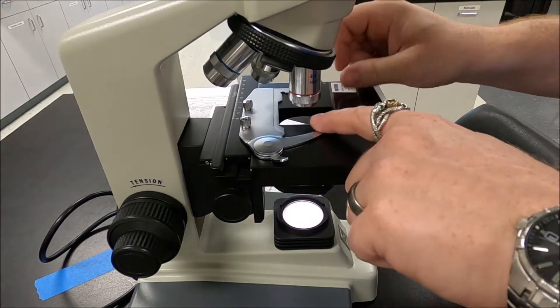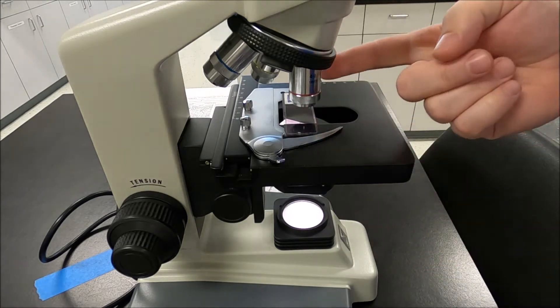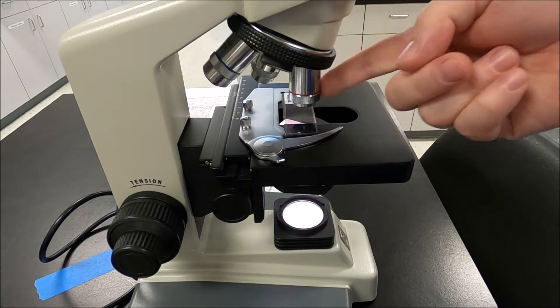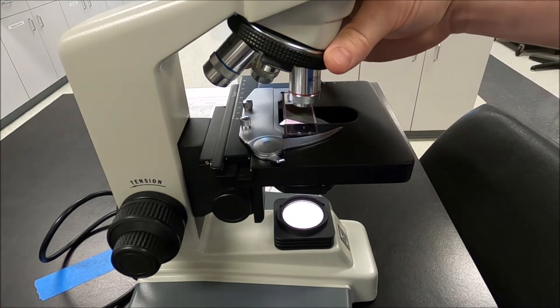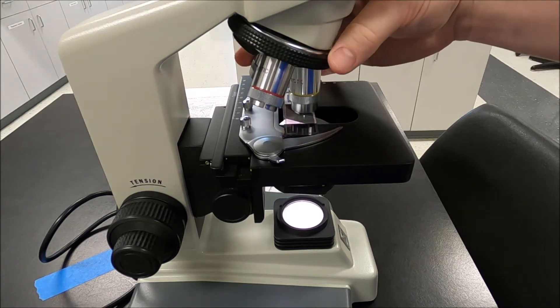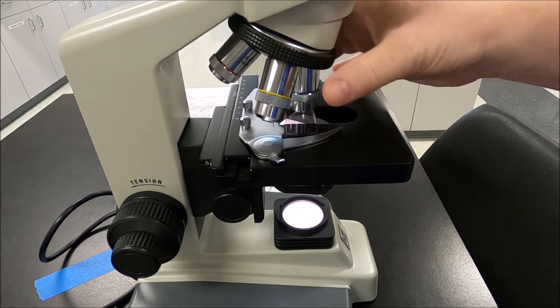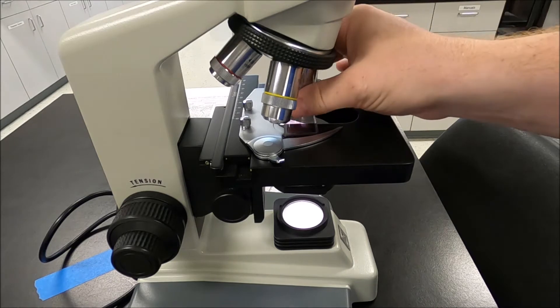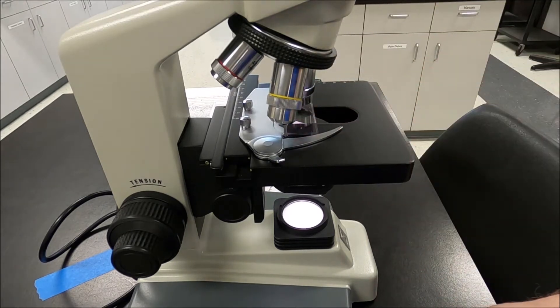Full disclosure: I'm setting up a scope to look at blood. The lower power lenses are absolutely useless — what you're going to see is just a pink color. When you go to a higher power lens like this 40x, that's when you'll be able to start making out the individual blood cells.